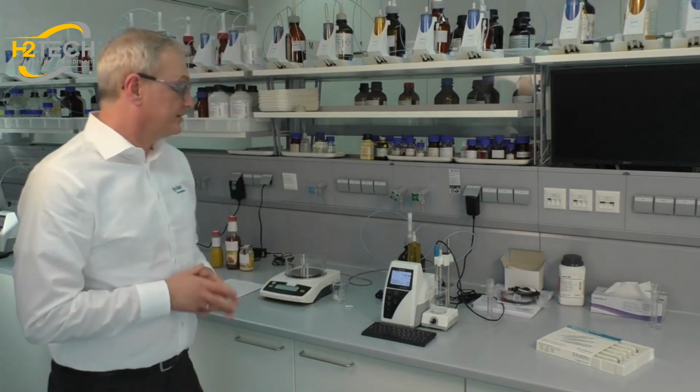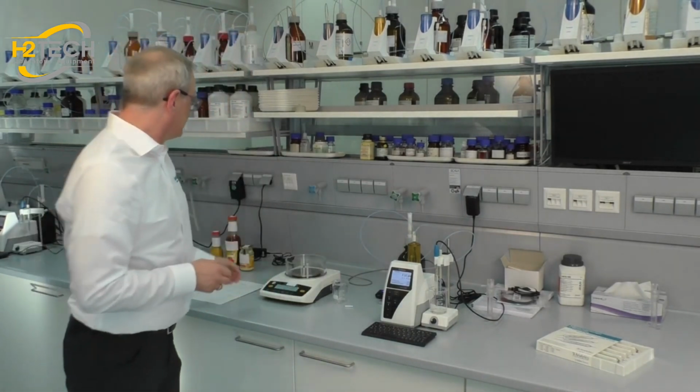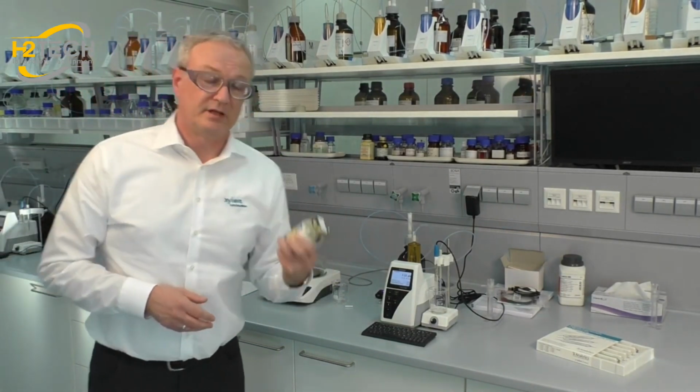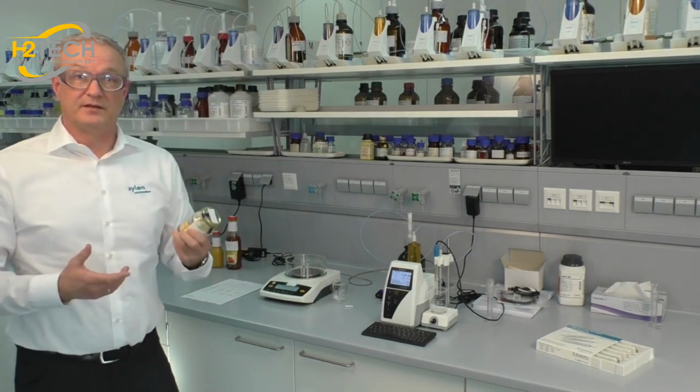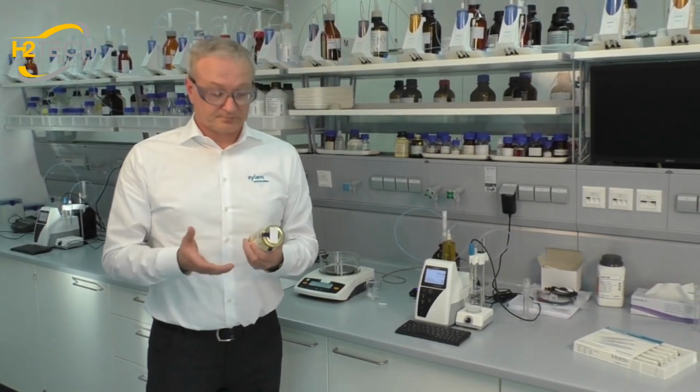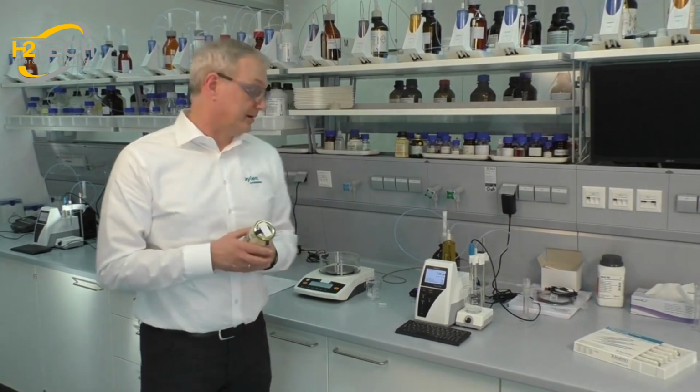In another video we showed you the titration of total acidity in fruit juice, and now we will show you something different. We want to titrate the acidity in a mayonnaise, not a liquid. It's a more solid sample, and the difference is we don't have citric acid as in a juice. We have vinegar, acetic acid, in the sample.